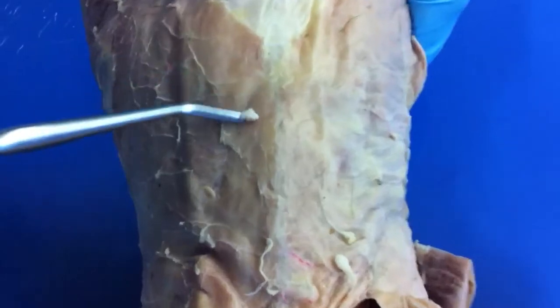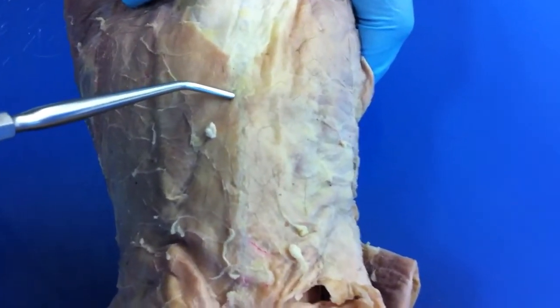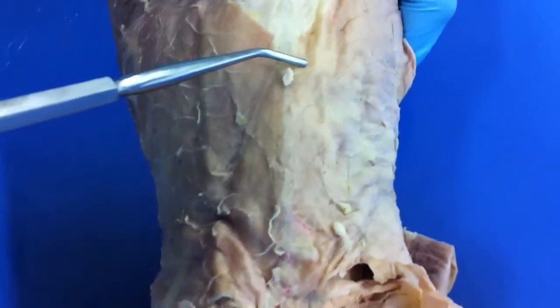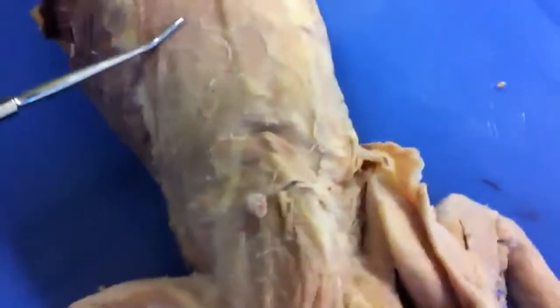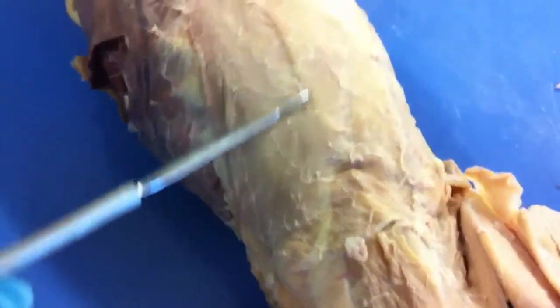The spinotrapezius is really faint here, but you can see the outline. It basically originates right at the edge of the lumbodorsal fascia and kind of goes up in a V-shape from there. The latissimus dorsi is basically just a big flap of muscle that inserts into the humerus from the back.